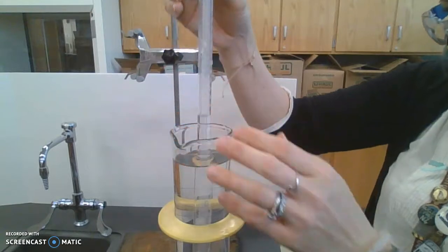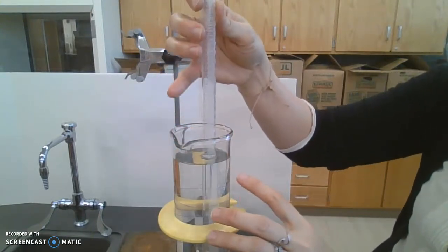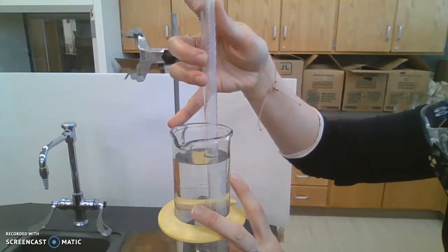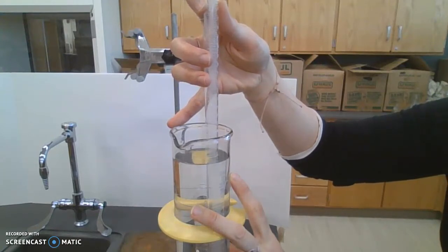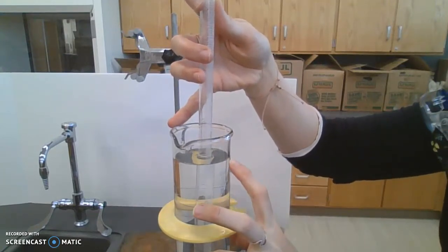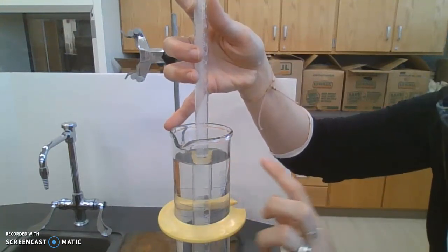So we have to normalize the pressure. So this needs to rise and fall so that we're at the exact same level. And this ends up making 30.9 milliliters of gas. All right. So it says 30.9 milliliters of gas. It's one mark short of 31.